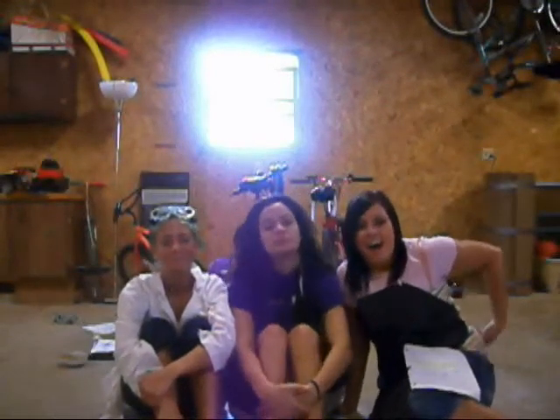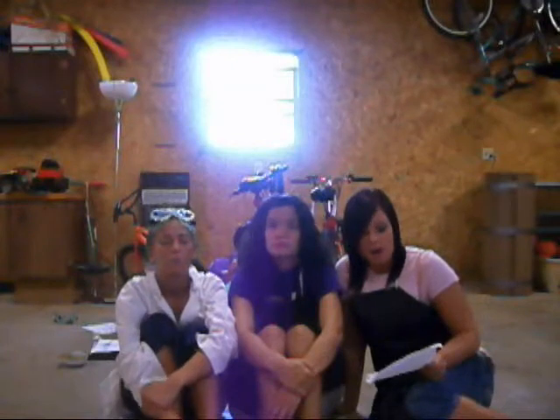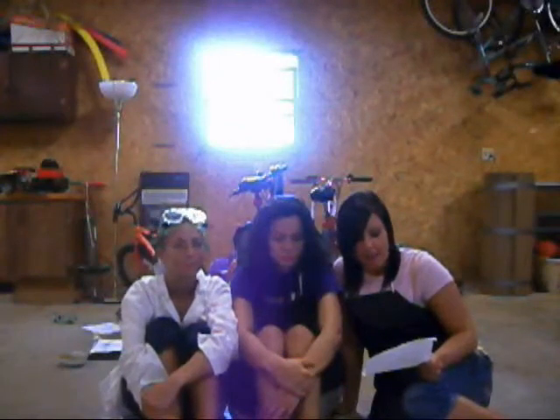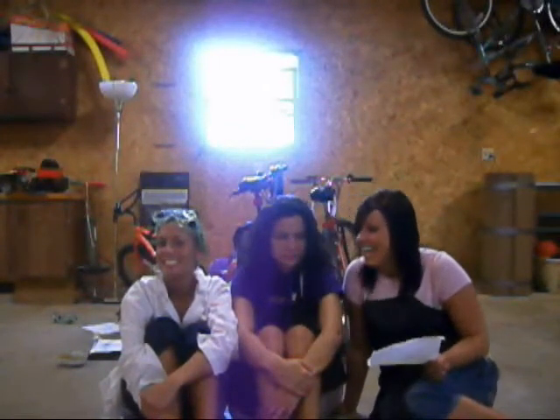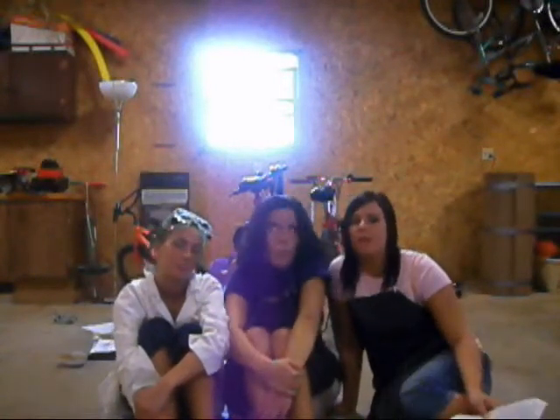And I should have been wearing proper clothes in the lab, and I didn't have goggles, I had sunglasses on, I didn't have an apron or anything. One of the lab rules is dress properly during a laboratory activity. Baggy clothing is a hazard in the laboratory. Clothing must be secured and not loose or in the way.